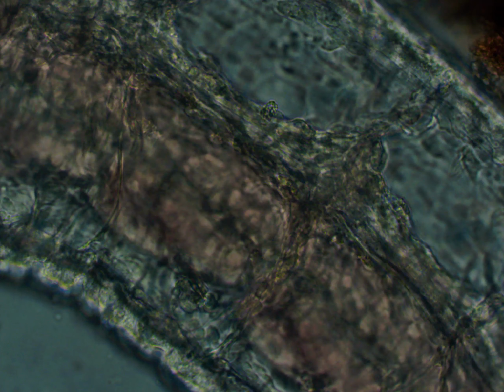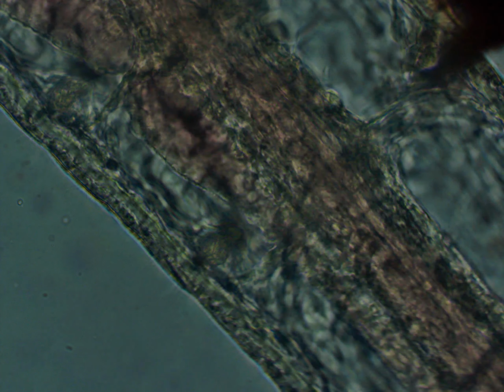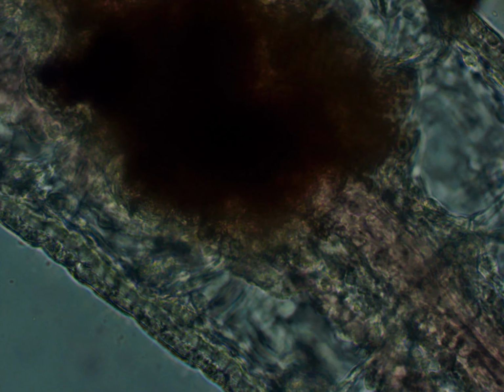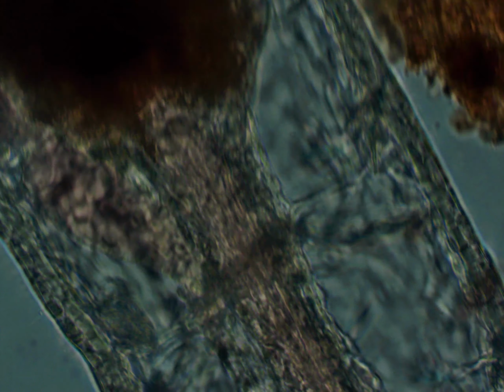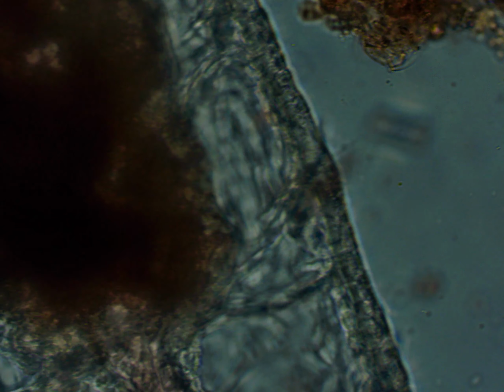Now here it is in just regular bright field. You can see all of those muscles contracting a lot better, which is actually due to the low depth of field of bright field, where you can take a segment and then just view that single segment of something. This is one of the times where a low depth of field is actually an advantage.